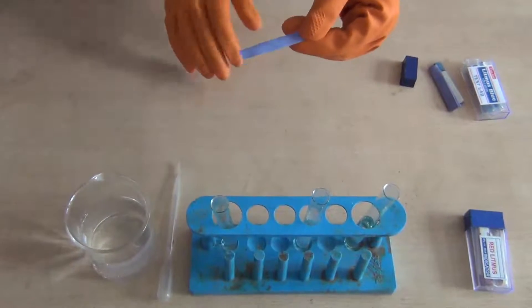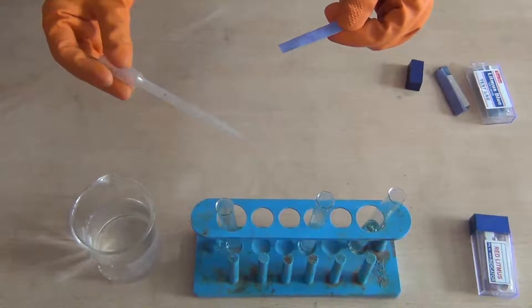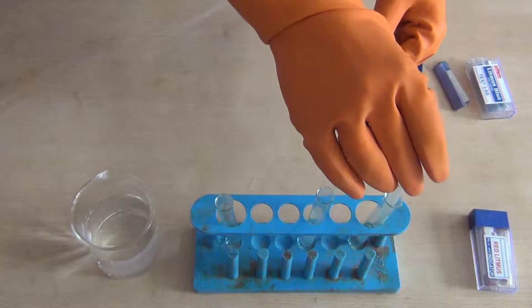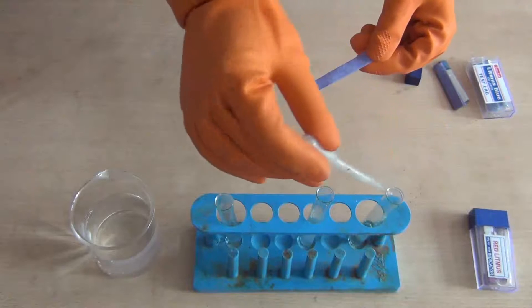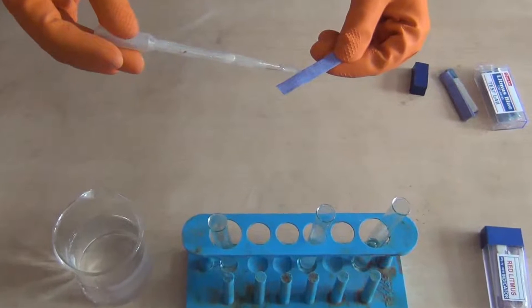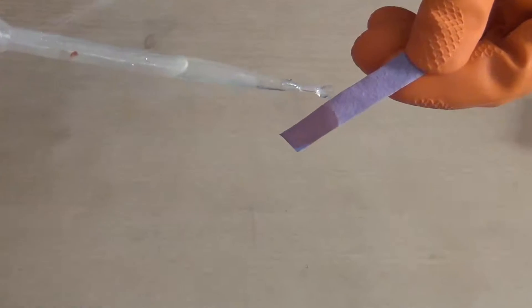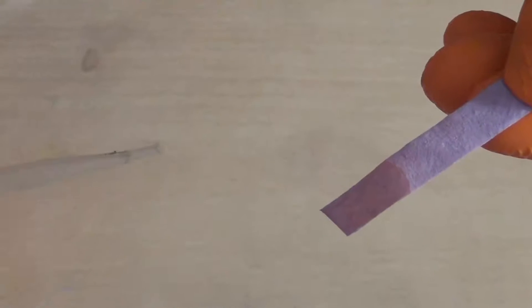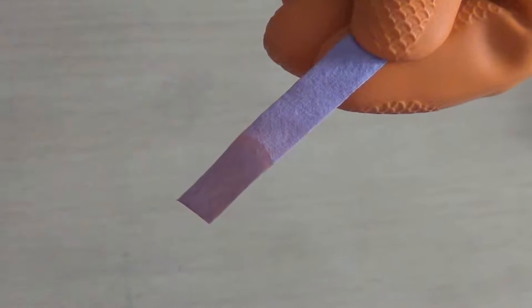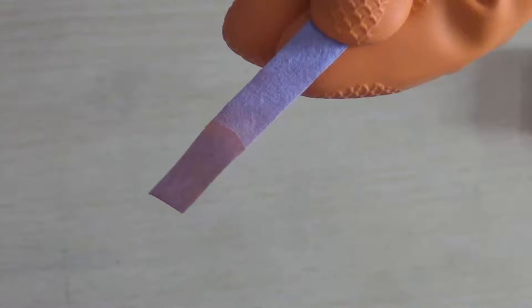As you can see, the color of the litmus paper is blue. Using a dropper, take some amount of solution from the first test tube and pour one or two drops onto the litmus paper and observe the change. As you can see, the color of the litmus paper has changed from blue to red. So the solution sample taken in test tube A is acidic.